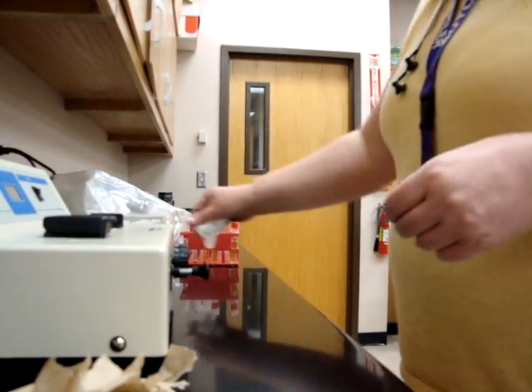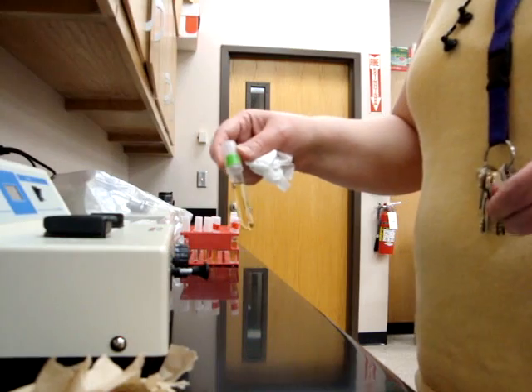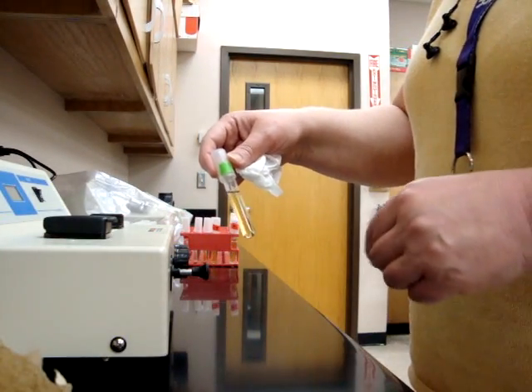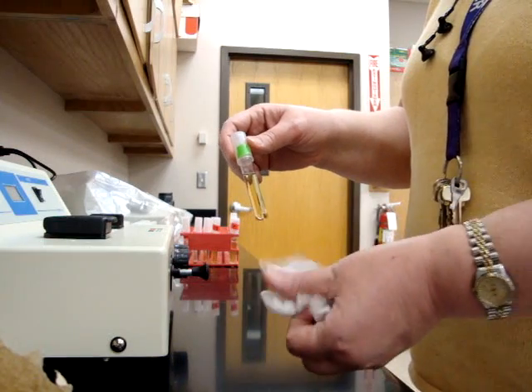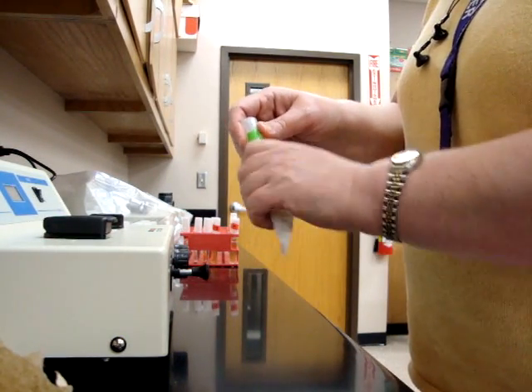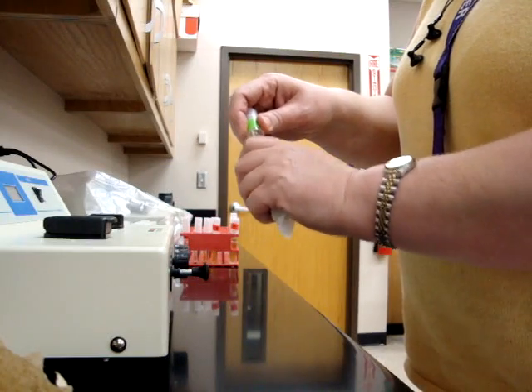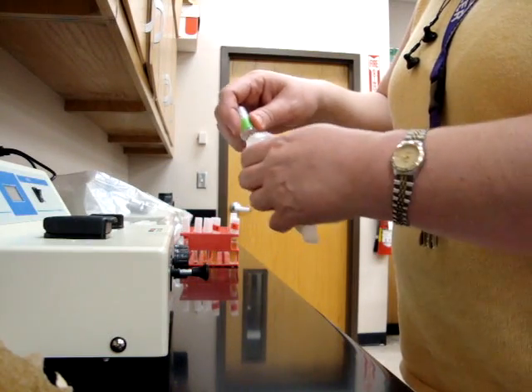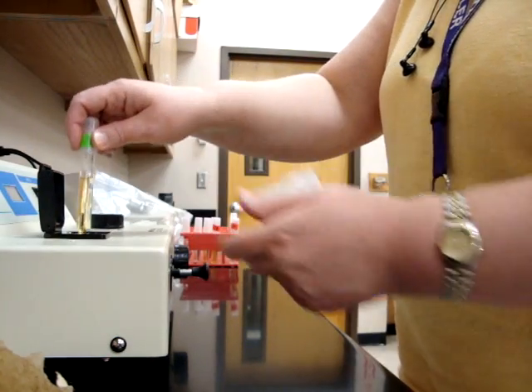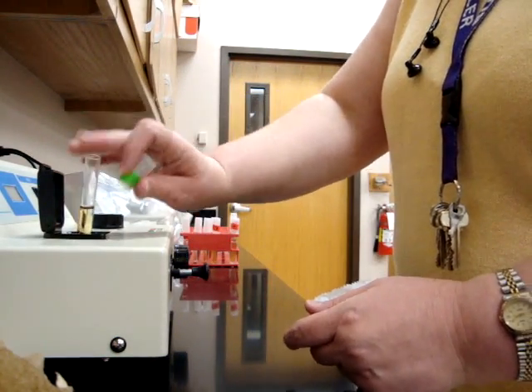I'm going to show you how to clean the blanks before you get started. Here's the yeast one that we used in the example, and you're just basically going to find some lens tissue and wipe off all the fingerprints — it's mainly at the bottom, but the whole thing needs to be cleaned off pretty well. Then you can insert it into your spectrophotometer.